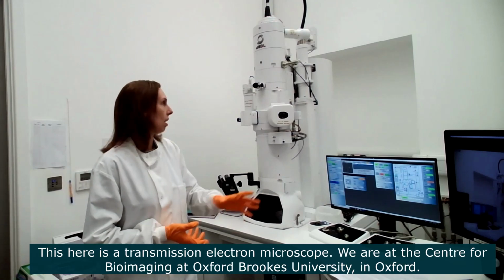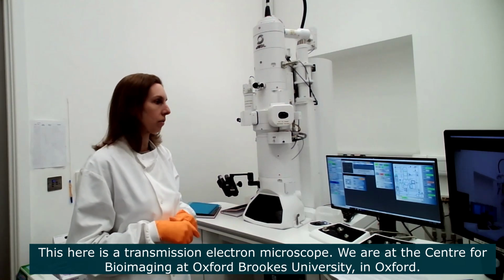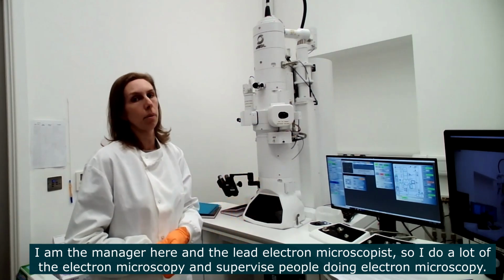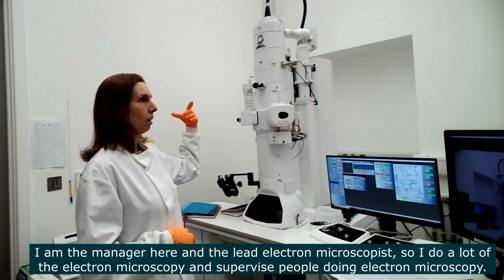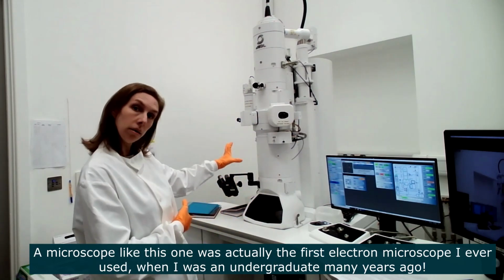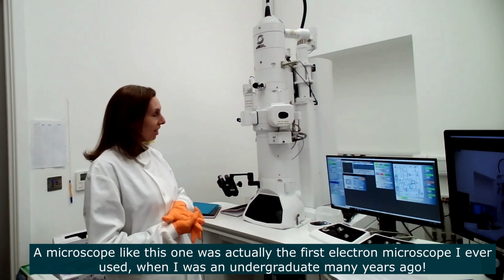So this here is a transmission electron microscope. We're here at the Centre for Bioimaging at Oxford Brookes University in Oxford. I am the manager of the Centre for Bioimaging, but also the lead electron microscopist. So I do a lot of the electron microscopy here, and I supervise people that do electron microscopy. A microscope like this one, a transmission electron microscope, was the first one I ever used when I was an undergraduate many years ago.